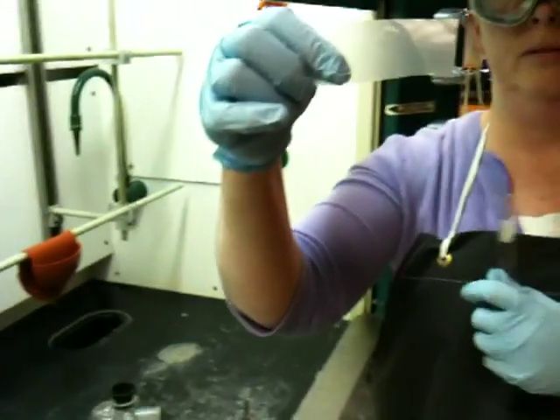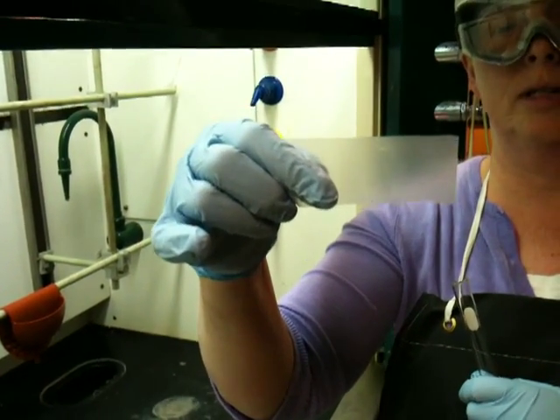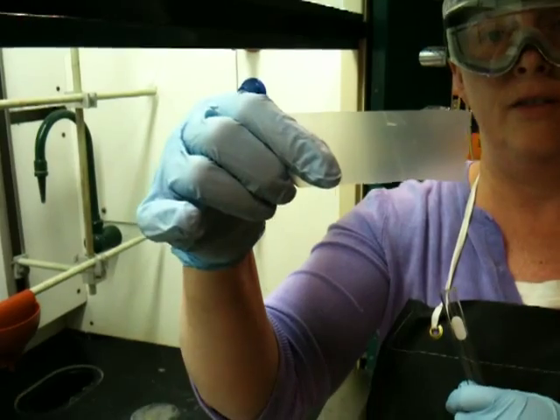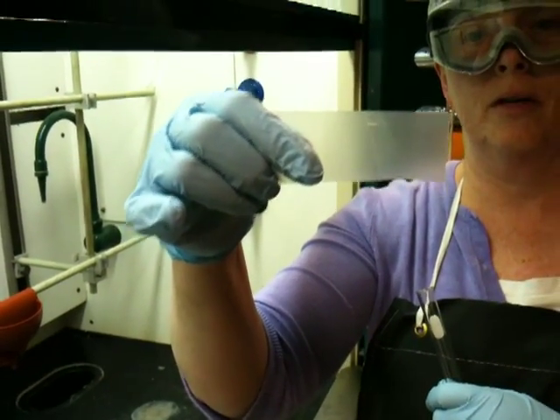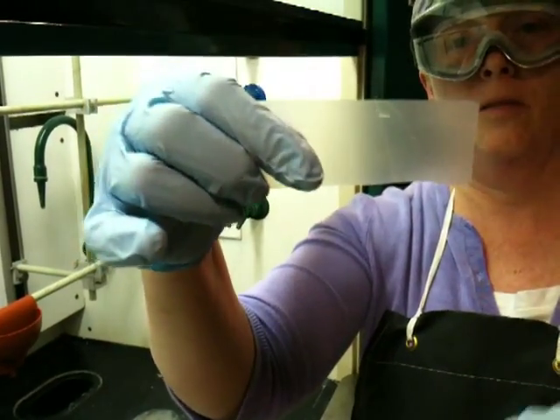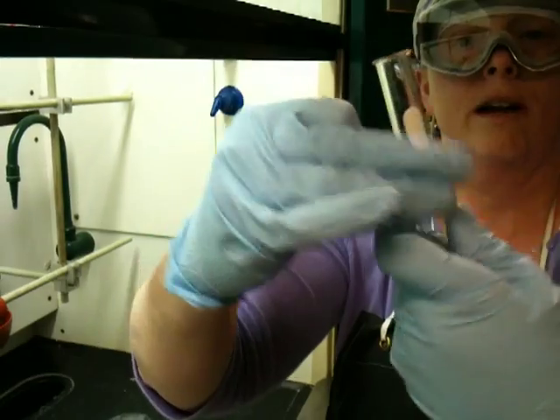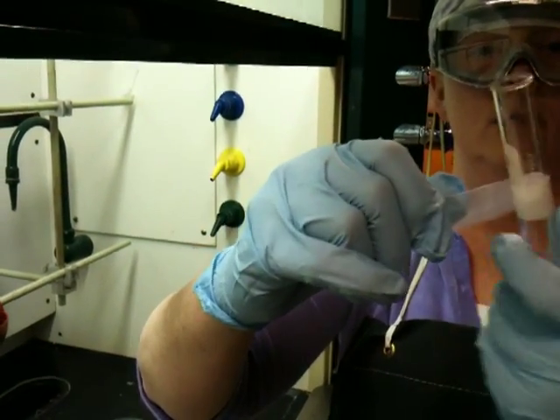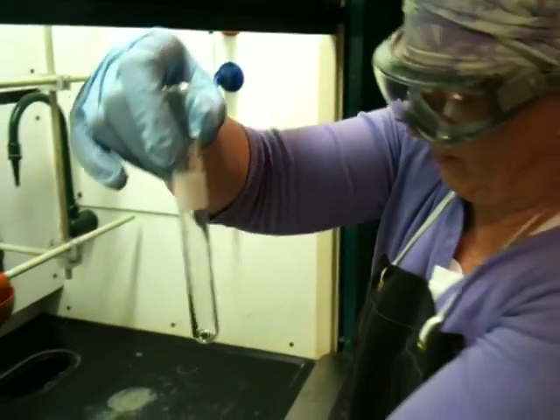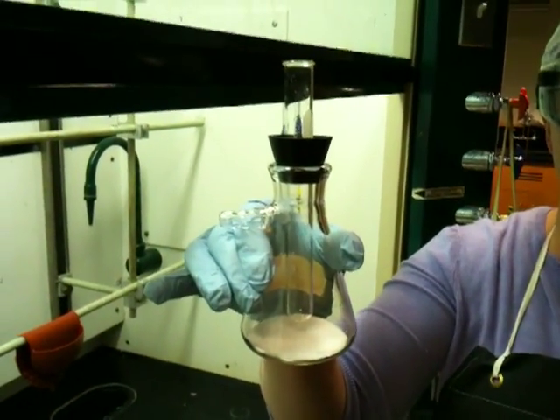The test tube needs to have some parafilm wrapped around it so it will sit properly in the sublimation apparatus. We will give you parafilm. Parafilm is stretchy, sticky, and it seems to have multiple uses in an organic lab — but it actually does not, because most organic solvents will dissolve parafilm. So don't take it on as your favorite sealing agent. But in this case, it's useful because we're going to use it to create some more thickness around the test tube so it will fit properly in the apparatus.